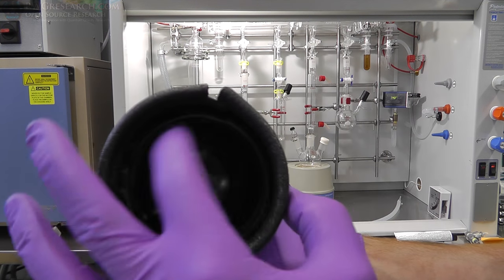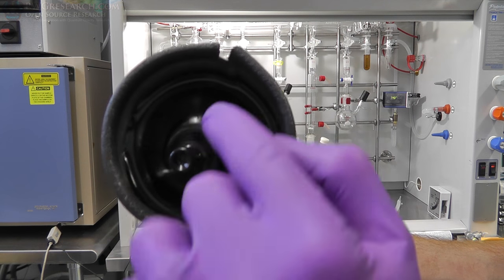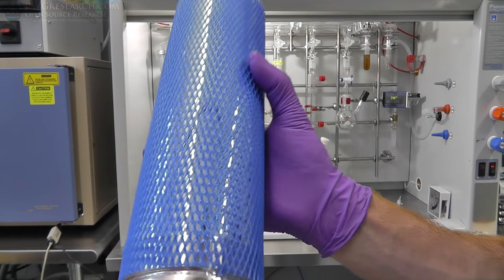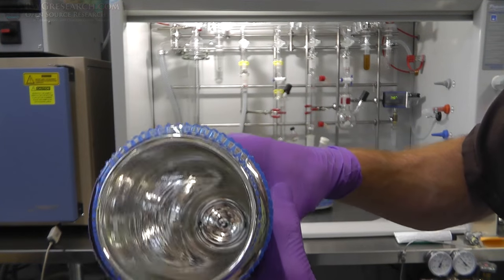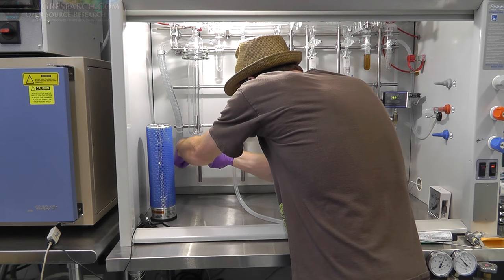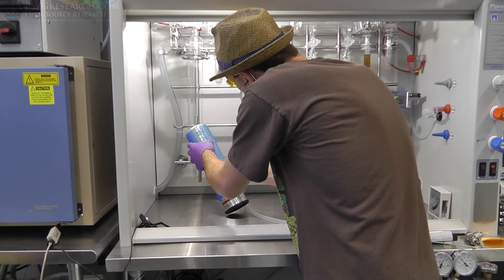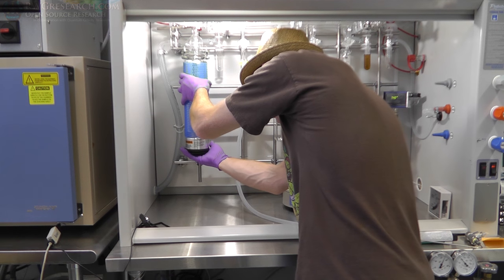So here you can see this is probably the glass section here. I don't think this is metal. And then they've capped everything off with a really solid glue. Not quite sure if they just glued it on there that way or what. But anyway, this is what a liquid nitrogen dewar looks like. So you could put liquid nitrogen in it, and then you would stick it in here. As you can see, it's a tight fit.